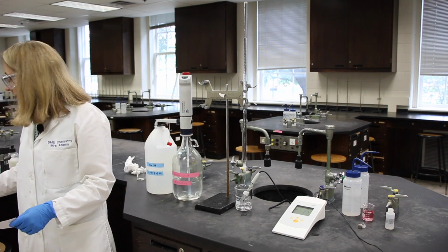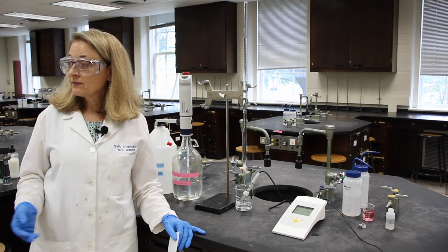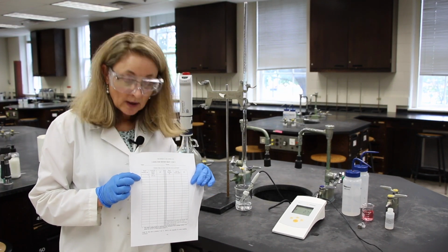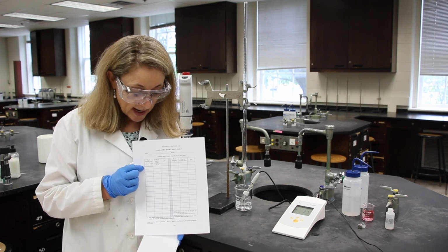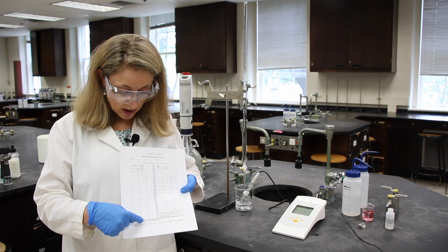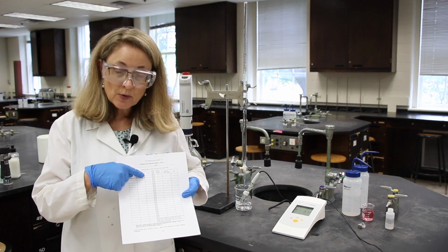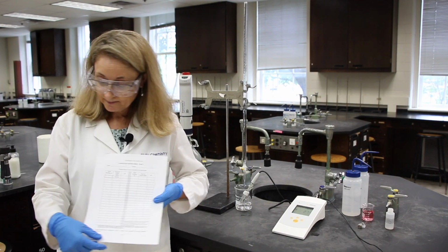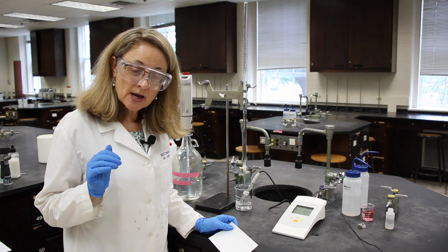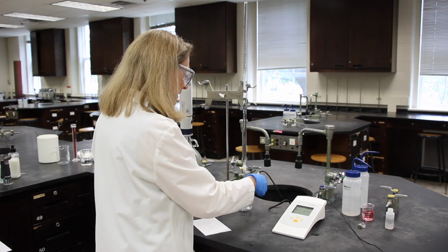So in your recording, I'd like you to read 9.25 at the very, very top in this bold box right here. Now this is important because we're going to be subtracting this value from each one of these when we calculate this middle column. So right now you should have 9.25 and 2.74 as a pH. I'm going to drain it in about 1 milliliter increments. It doesn't make any difference how much that needs to be exact, but it just makes everything go a little bit more smoothly.